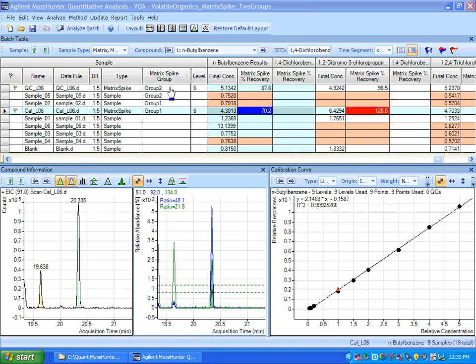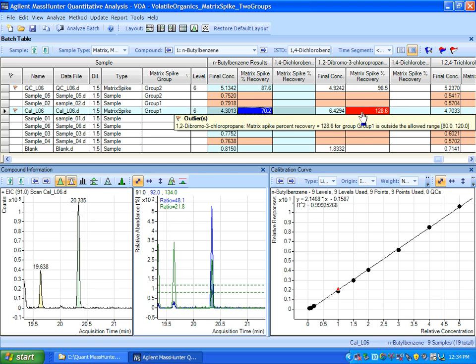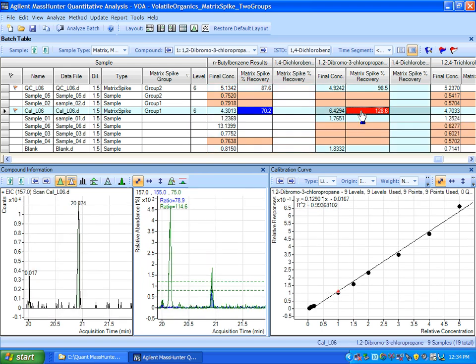Let's take a look at the matrix spike group. The key difference here is that I've associated these samples together, the matrix spike and the sample, by putting a matrix spike group designation. There's group 2 and there's group 1. And if I look at the results here, I can see for N-butylbenzene, the recovery in group 1 turned out to be quite low, a little bit low. And if I look over at the compound 1,2-dibromo-3-chloropropane, you'll see that the recovery is a tad high, and that's shown by the outliers here.